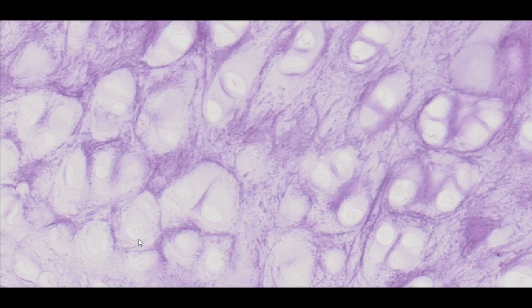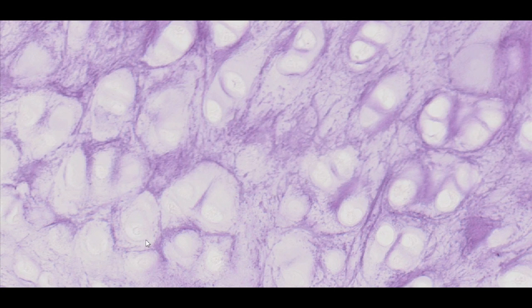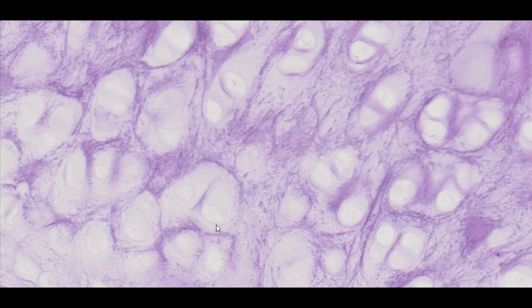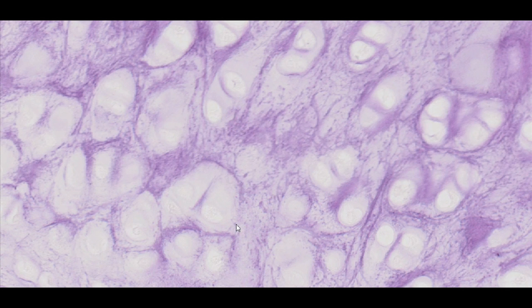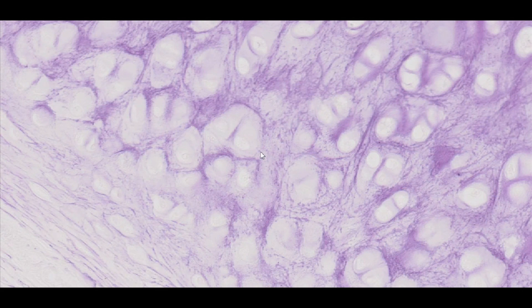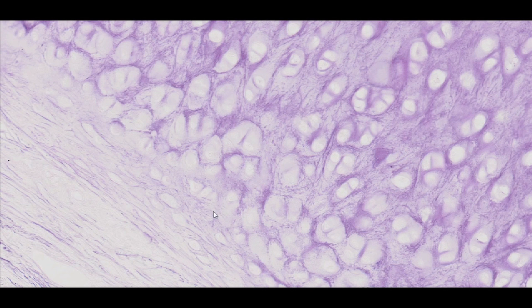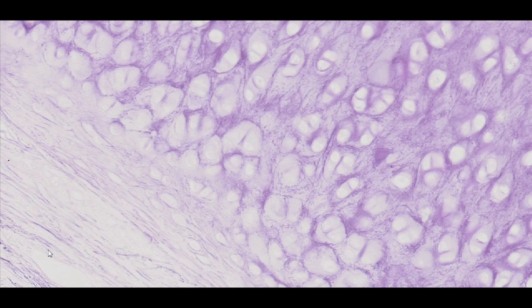We should remember that each empty space within the isogenous group is a place where cells are located. Apart from elastic fibres, there are also type 2 collagen fibres within the intercellular substance of elastic cartilage. This collagen, like the one in hyaline cartilage, forms a network of thicker fibres which appear wavy and disordered.